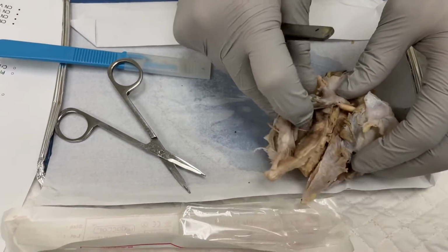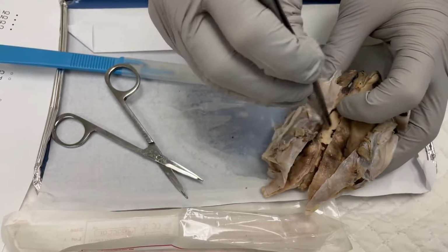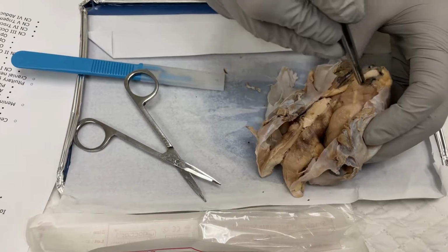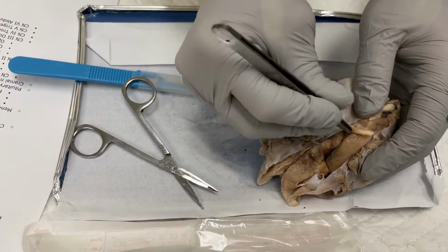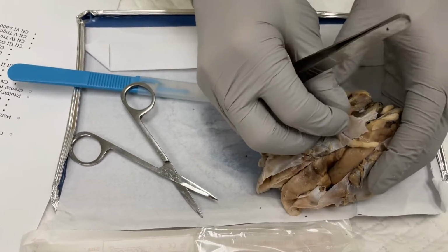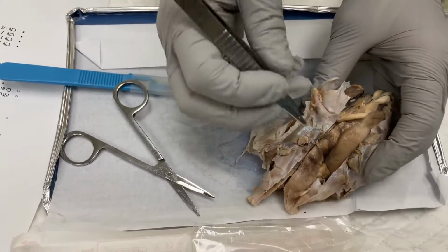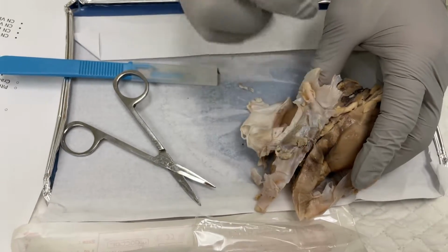After that, we have the pituitary gland, which would be here on the bottom of the brain. After that, we have the olfactory bulb, which is towards the front right here. And then we have the optic tract, which has the optic nerve, and the chiasm, which is where they meet. Again, kind of covered up by the meninges. I didn't want to take those off and risk breaking this part of the brain. Then we have the oculomotor nerve, which would be here.